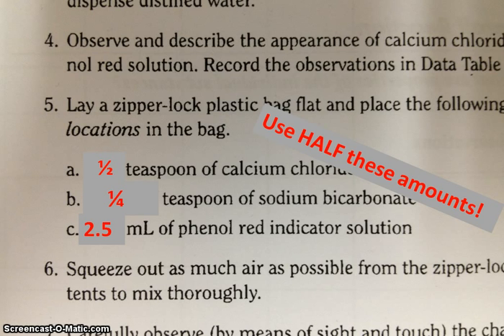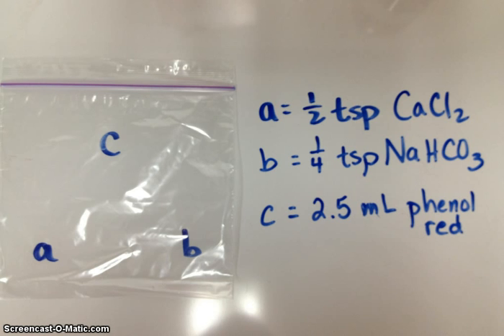When you get to Part B of this lab, the controlled experiments, you will continue to only use half of the amounts recommended in the original lab report. You will be doing this chemical reaction inside of a sealed Ziploc baggie, and it's important to keep the three chemicals separated until you have the bag completely evacuated of air and sealed with the Ziploc zipper.